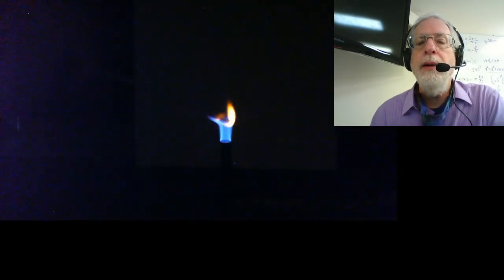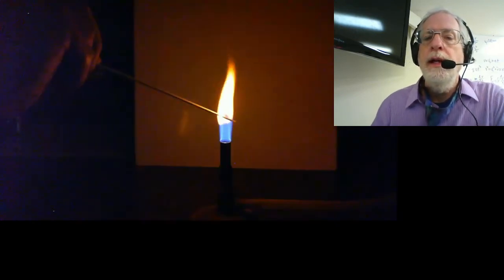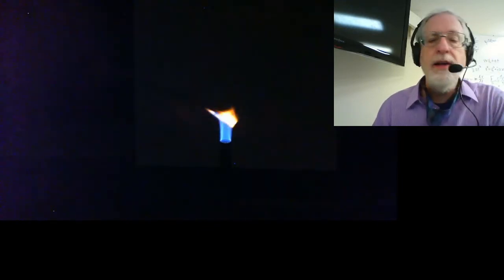And let me kind of go back through that and play it slowly. And I think I have a really good one in the middle here, I think is where I had one. I'm trying to pause it right there. So you can kind of see the flame coming off of this. I'll let it play normal speed. Once more. Right. So that's the color of sodium chloride.